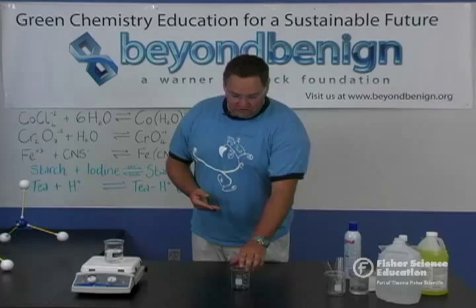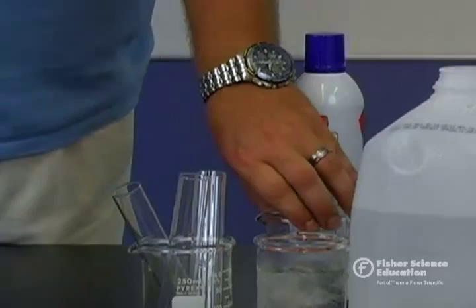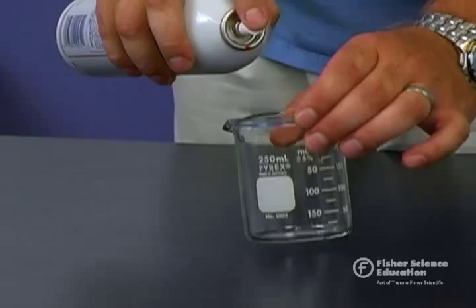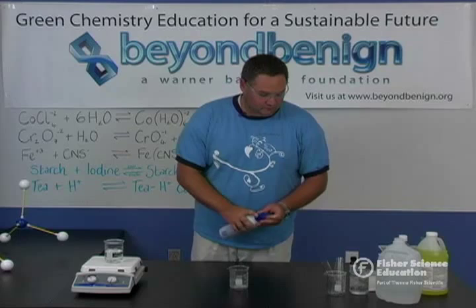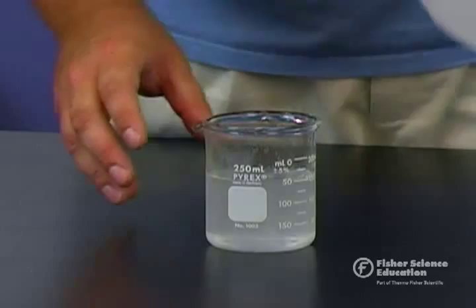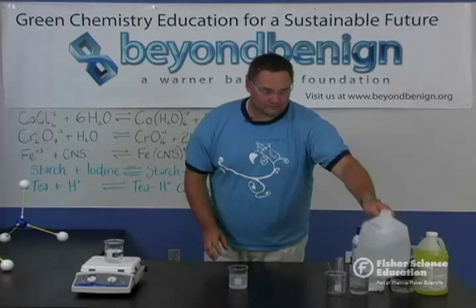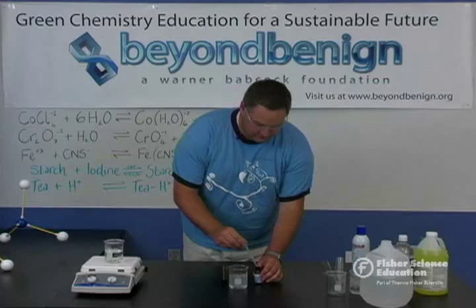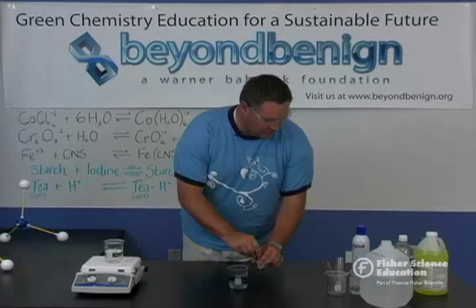The first reaction we're going to do involves starch and iodine. We'll take a clean, empty, dry 250 milliliter beaker and place in it just a few squirts of water-soluble laundry starch. To that we'll add approximately 150 milliliters of water, then add three drops of iodine to the solution in order to produce our starch-iodine complex.